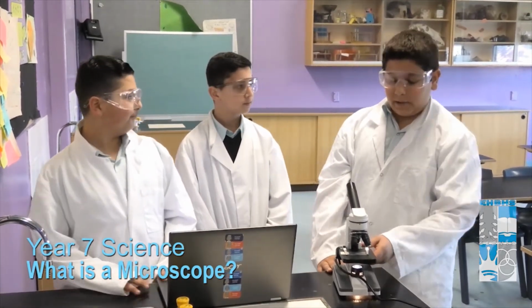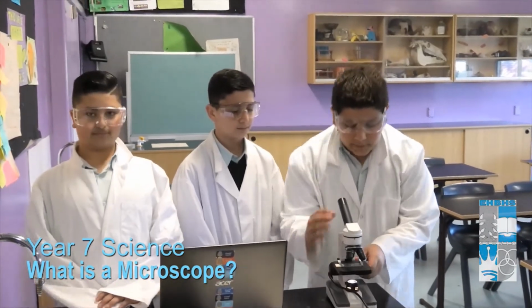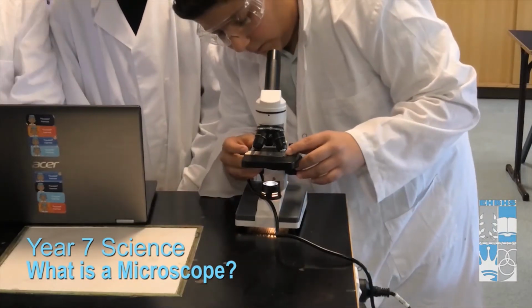Alright, back to the microscope topic. We'll be pulling the stage up closer so we can see it. Right now we can see the cat paw, but it's on the right. So we have to put it straight in the middle.